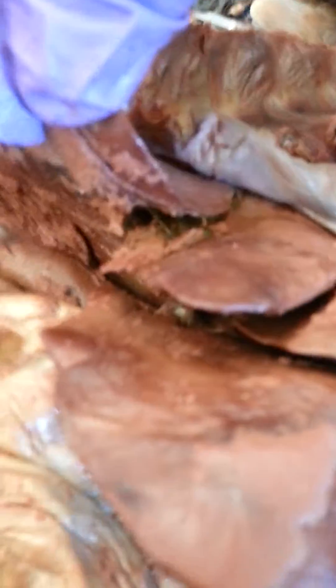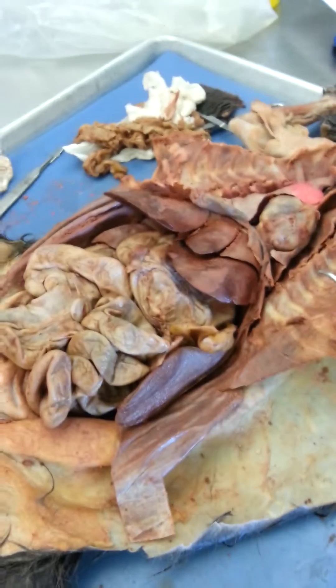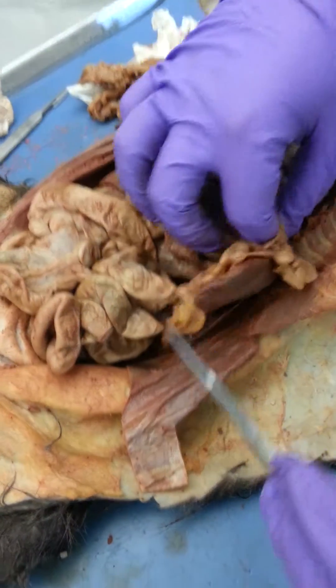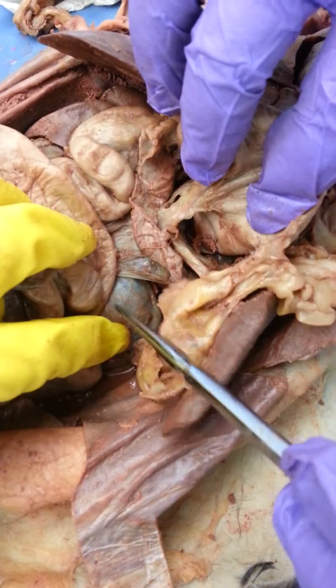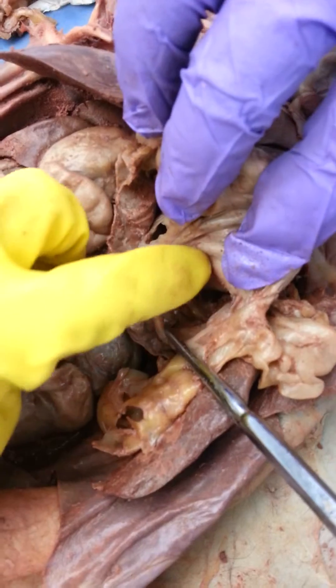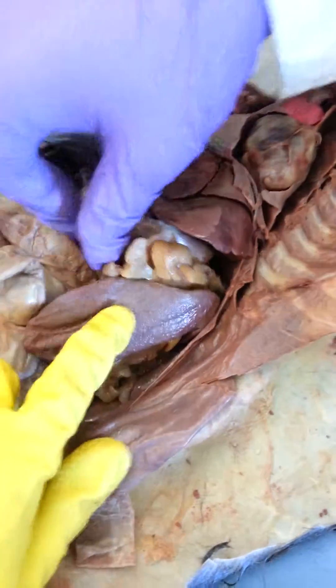The spleen — it's like the black thing. The pancreas is this thing here. To find it, find the kidney, and it's right up near it — these two things. And the spleen.